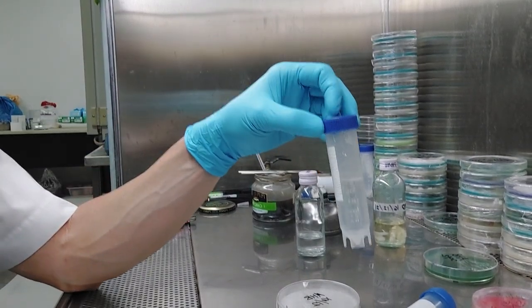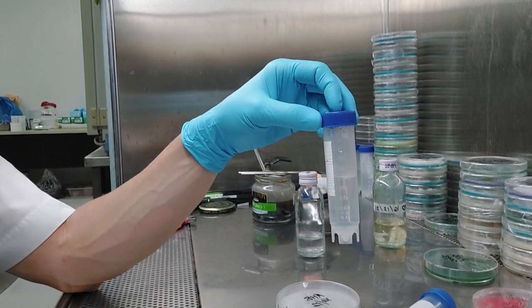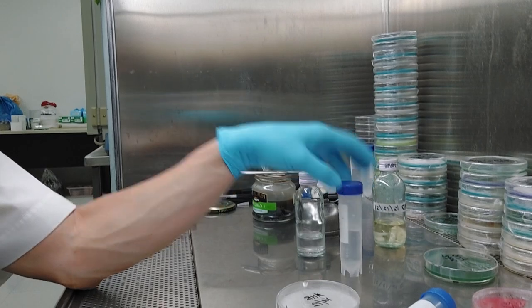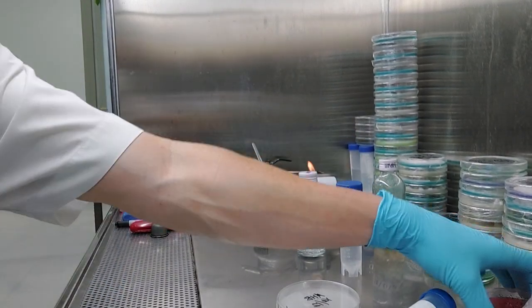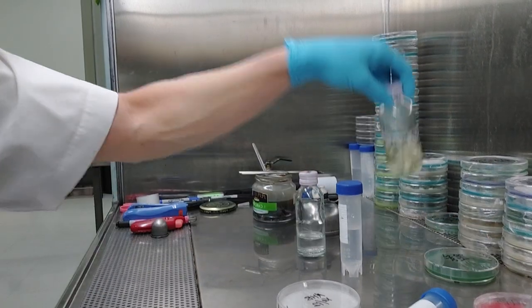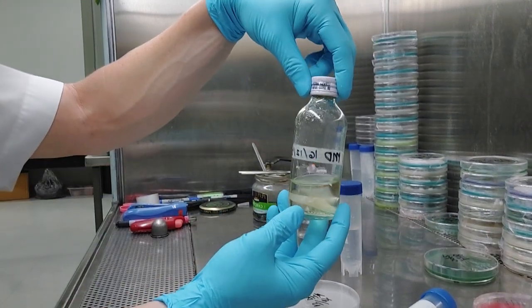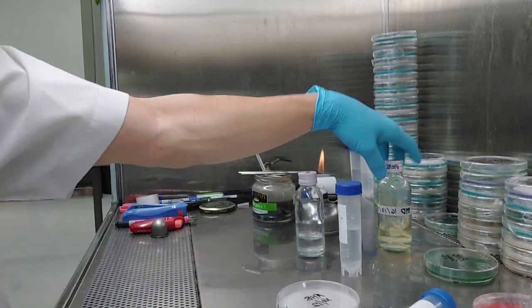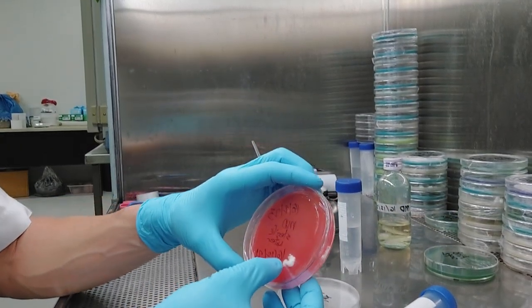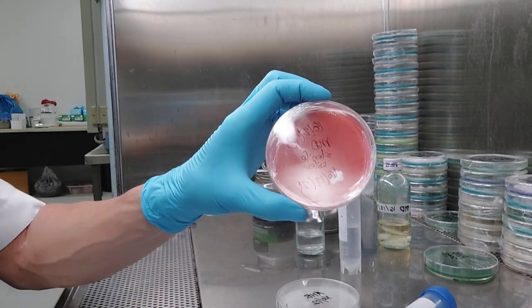There are references out there where people have pulled out cultures that were 30 years old, ascomycete cultures that were 30 years old and revived them. Just like I did, like that's only four days old. So that culture that I pulled it from has been sitting in my closet for almost two and a half years and I pulled that out and it started growing within four days. I don't know how well you can see that, but it looks perfectly fine.